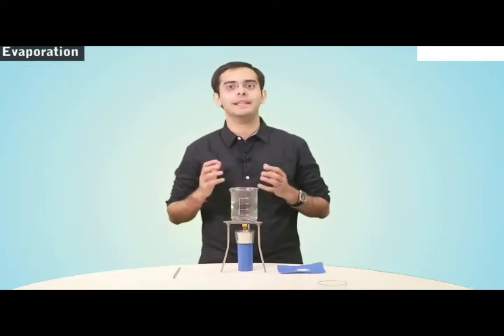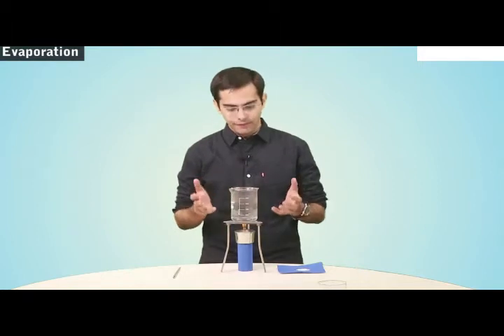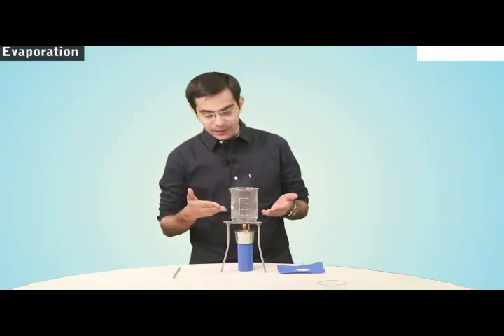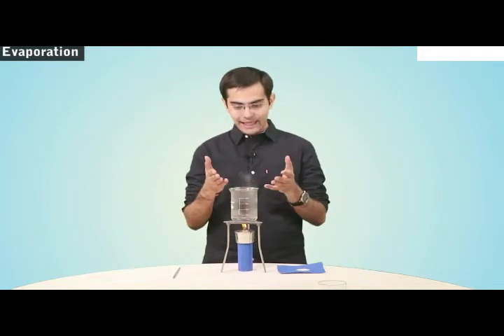Well, in this case, we have to look out for some new method of separation. So you know what happens when water is heated? Yes, it begins to vaporize quickly, and very soon the particles of water change from liquid state to gaseous state. So you can see here the vapors of water arising right out of this beaker. Now similar thing happens when we heat salt water.